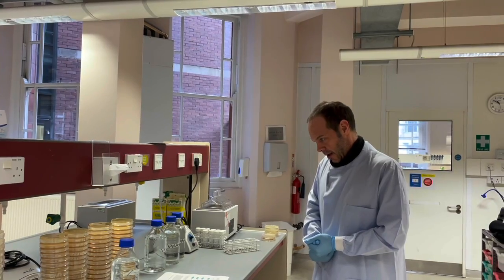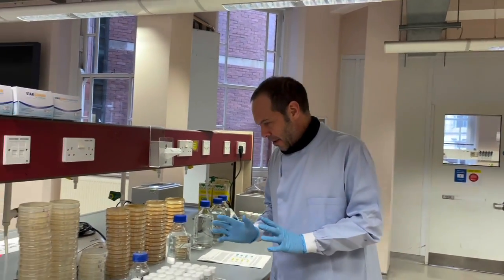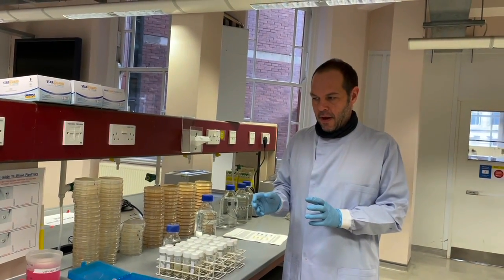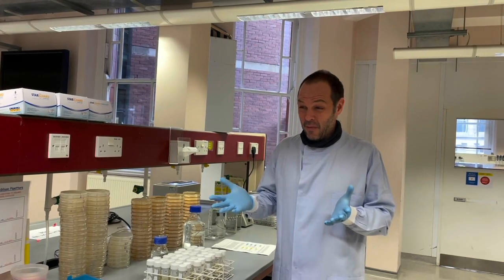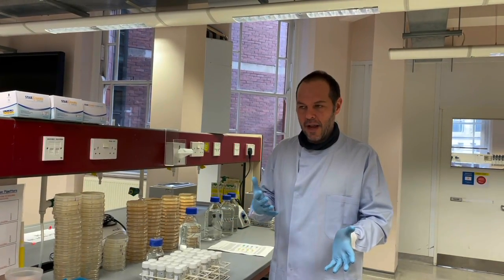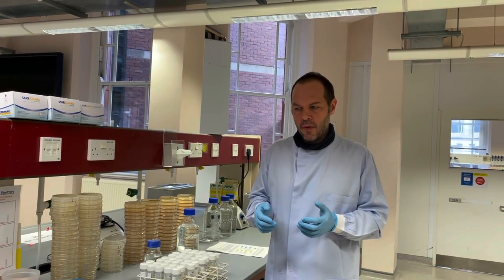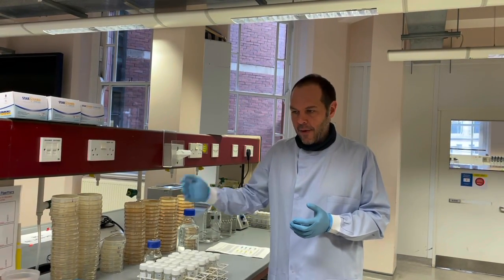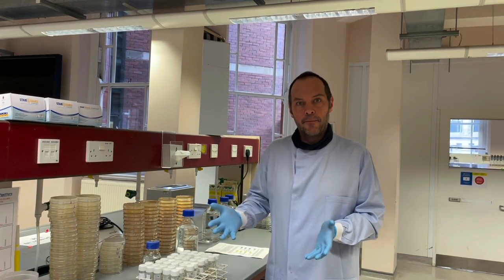All right, let's just start and see how it goes. So our first experiment is called plating, and it's really simple, but what I want you to think about at a more general level is what causes variation in an experiment? What are the sources of error?